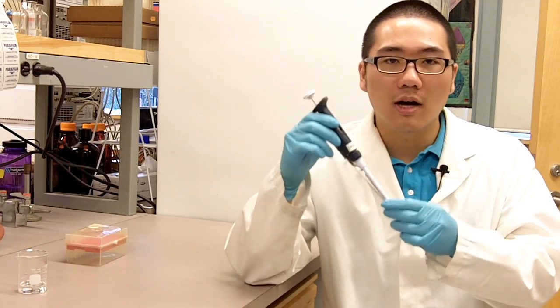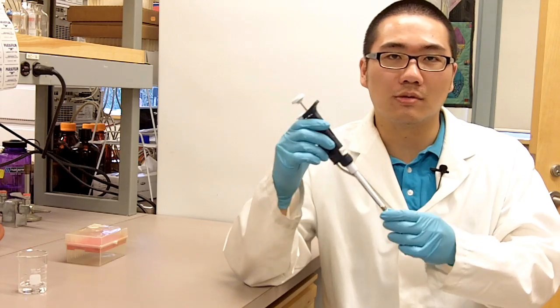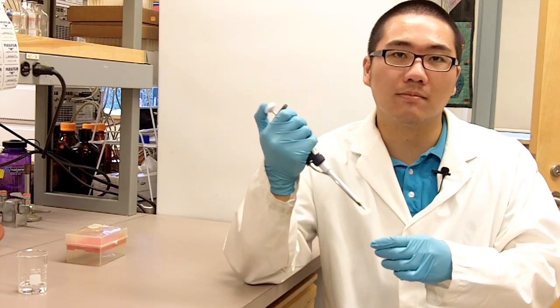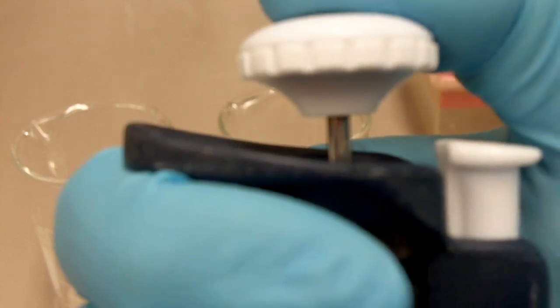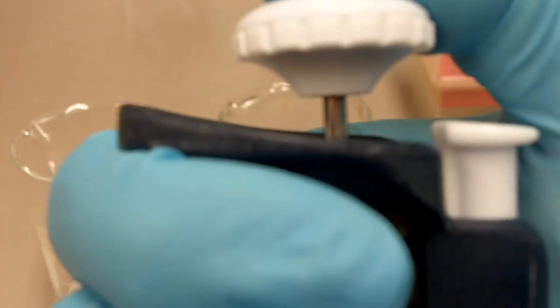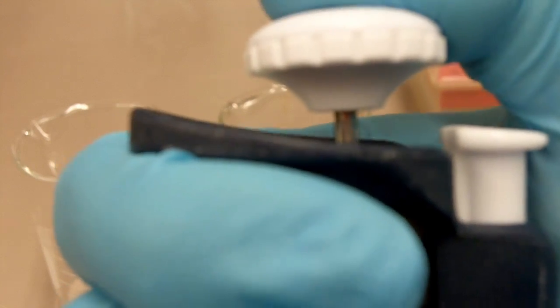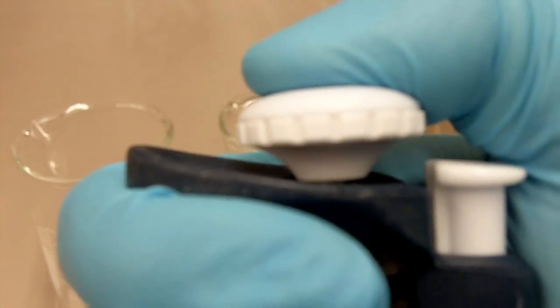I'm going to show you how to use this pipette to withdraw and dispense the solution using the push button. So if you press it down, you'll encounter the first stop. When you withdraw the solution, you only go down to the first stop. But when you expel the solution, you have to go to the second stop all the way like that.